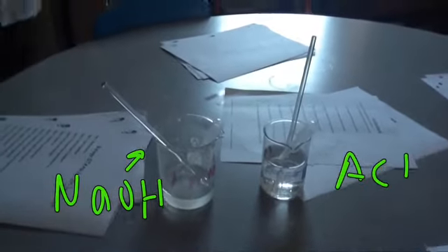NaOH, that's our base. You notice the base is clear. This next one right here is your acid. So acid's going to be on the right, base is going to be on the left. Got it? I'm going to take 2 blank beakers.